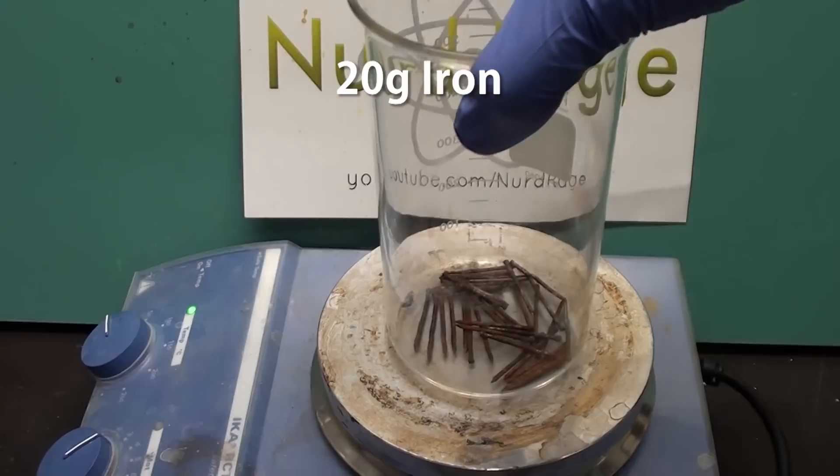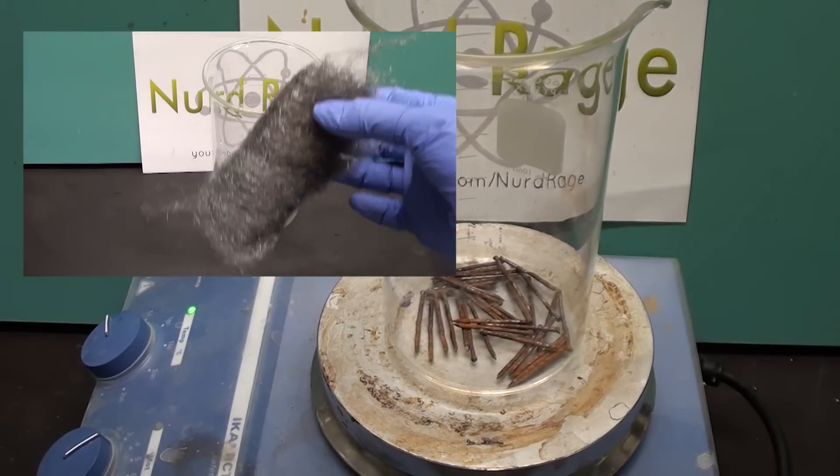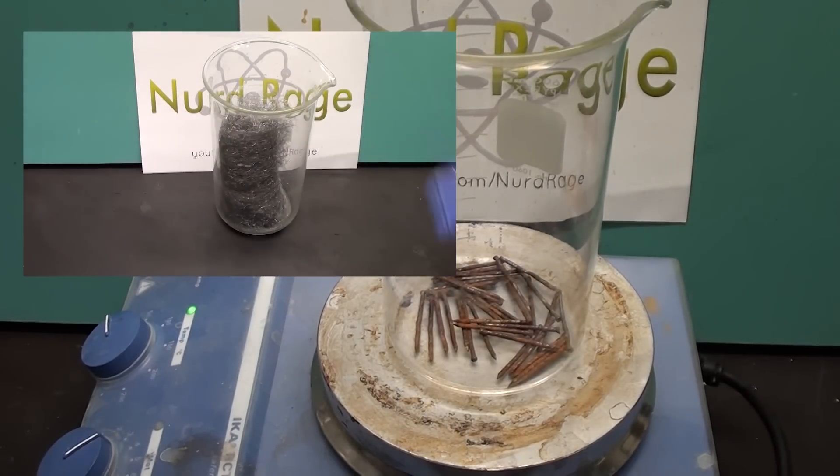Start with 20g of iron. I'm using iron nails but steel wool also works. Use whatever iron source is cheaper for you.